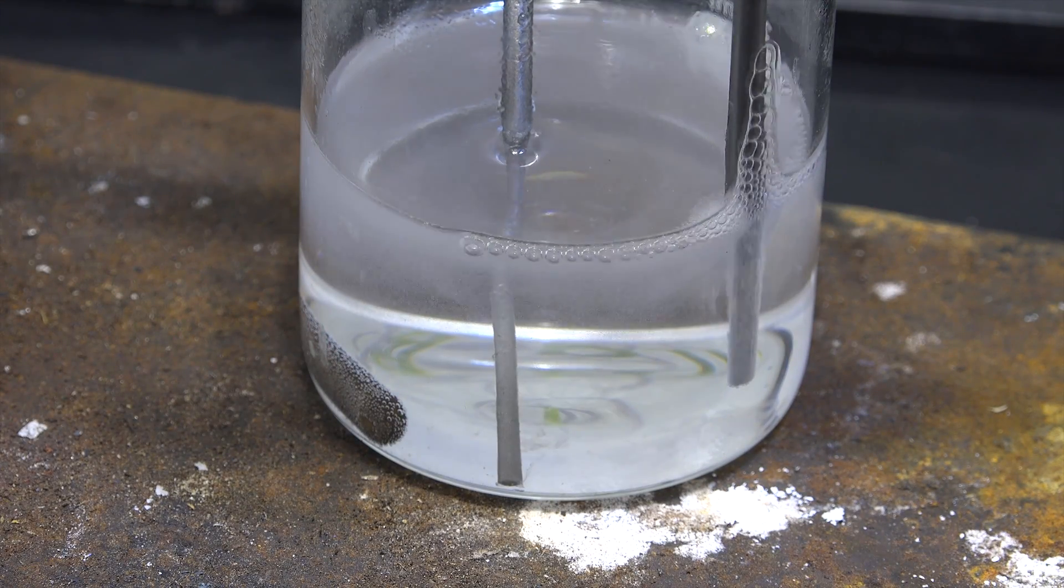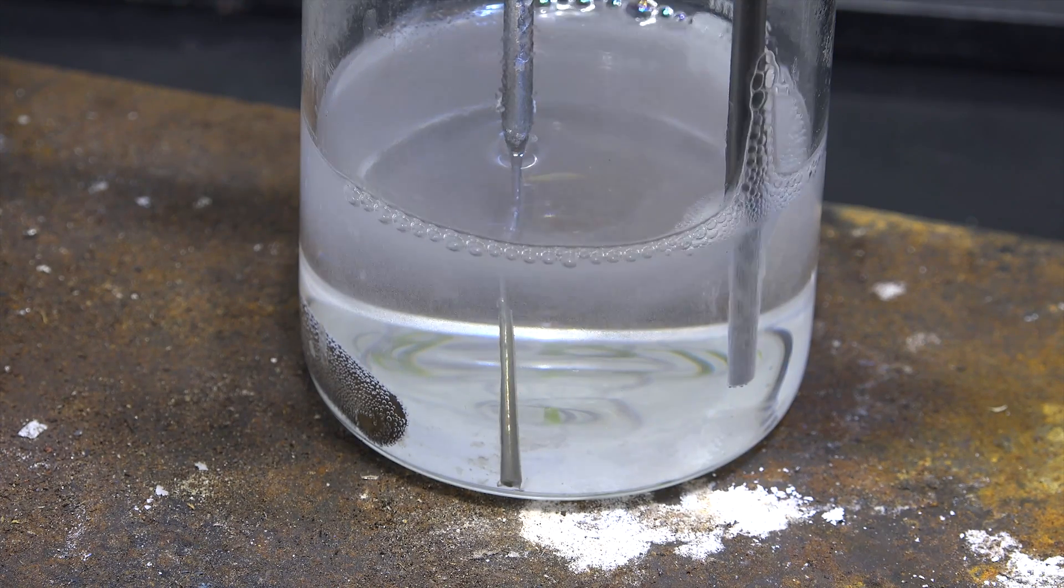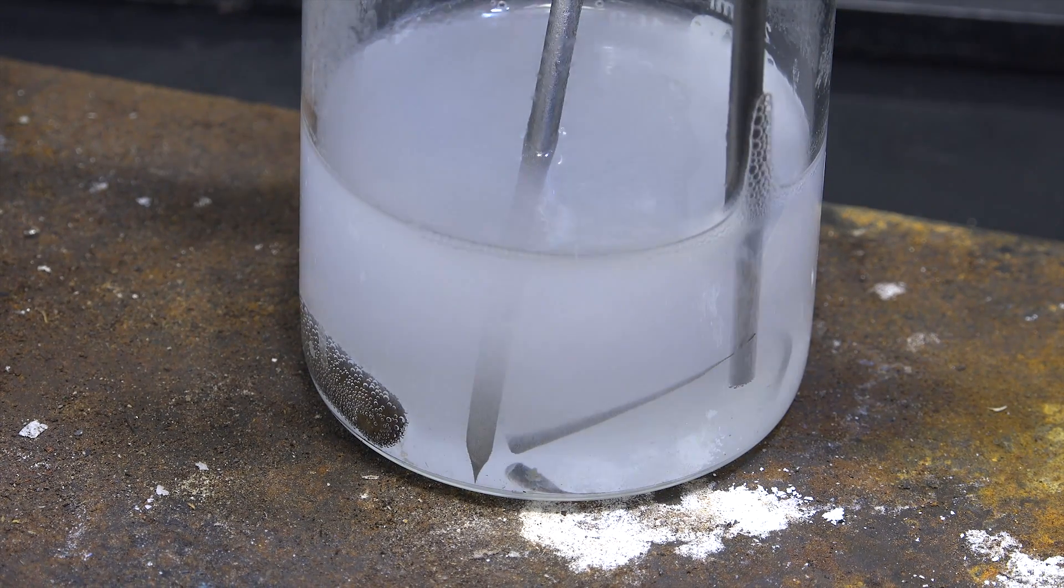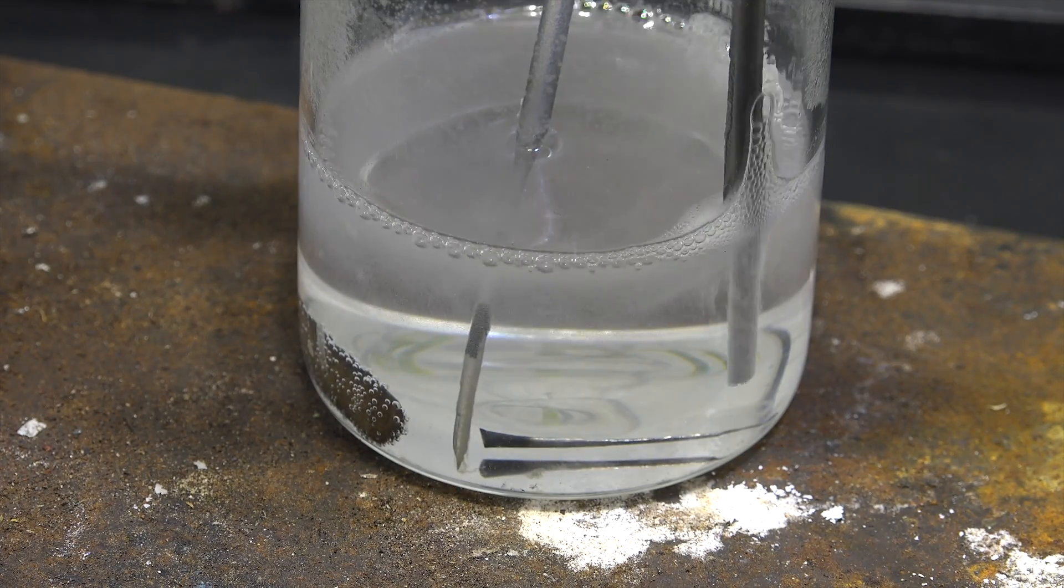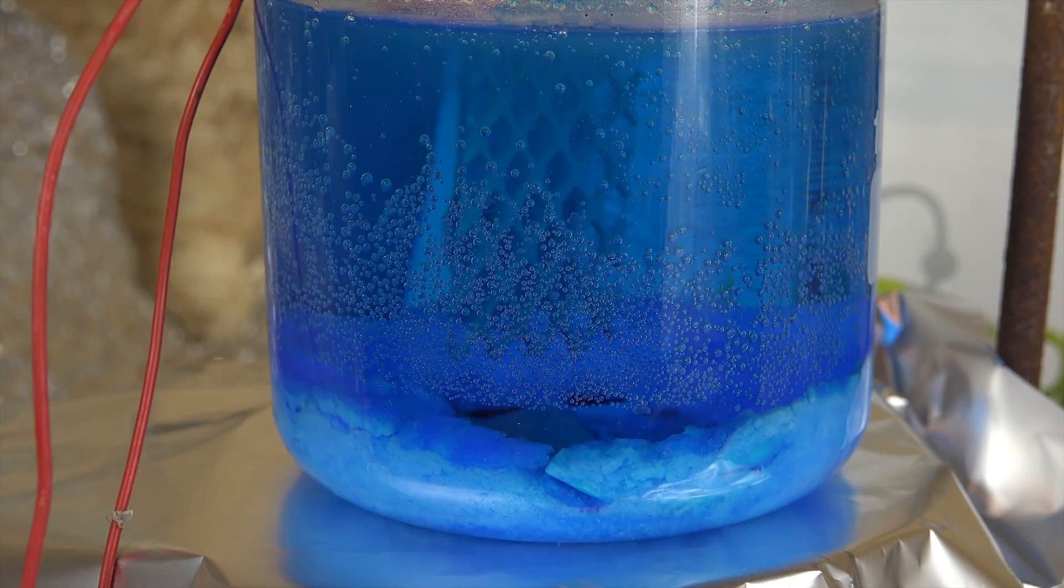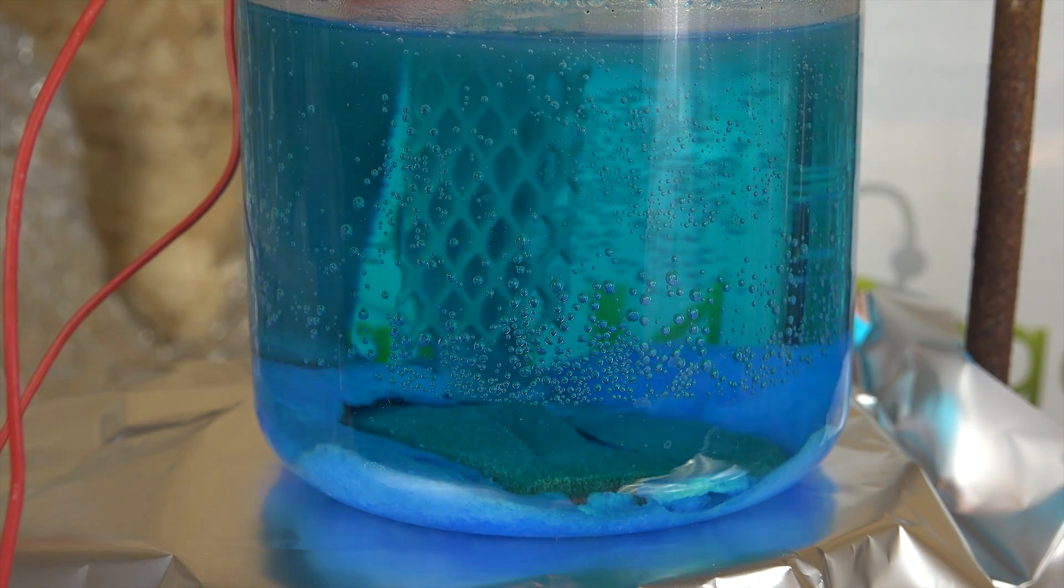Anyway, a quick introduction to why we want to make a membrane divide cell. So far we've done electrochemistry using undivided cells with both electrodes in the same solution. For simple experiments like making sulfuric acid from copper sulfate this is great.